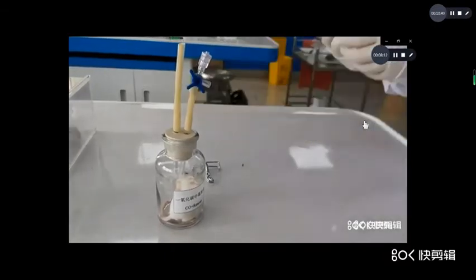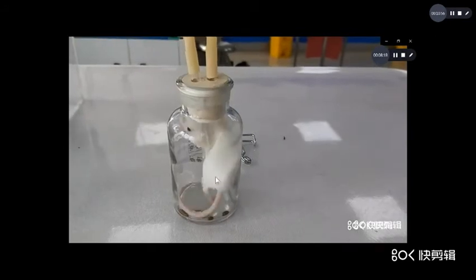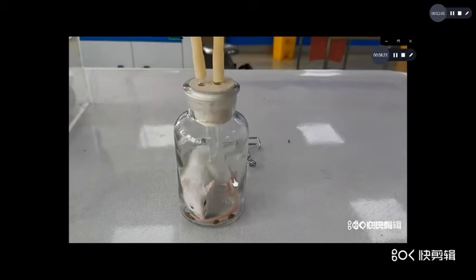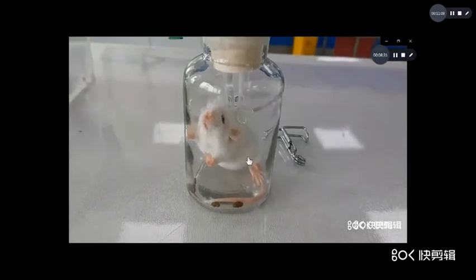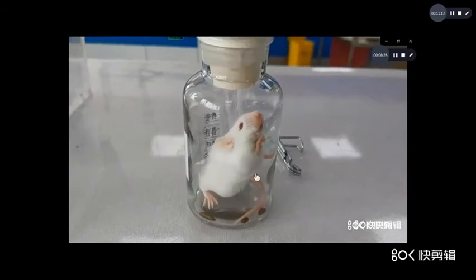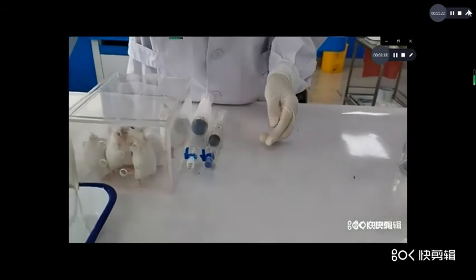Now you observe the manifestation of the animal. Now the animal first inhales carbon monoxide, carbon monoxide poisoning, and next inhales oxygen as treatment. Now you observe the manifestation. The animal will die or survive. Now the animal survives.